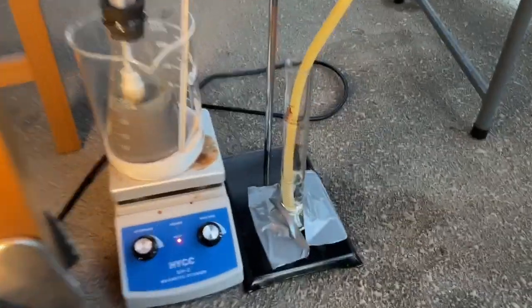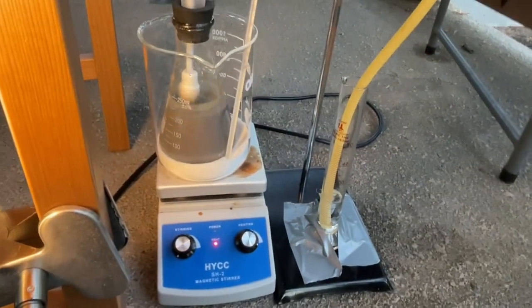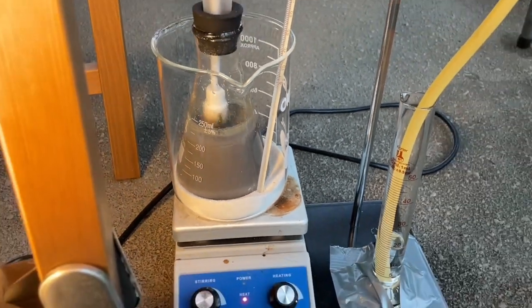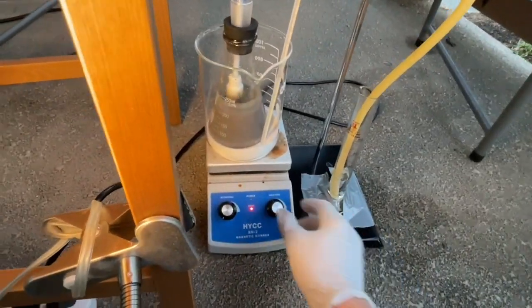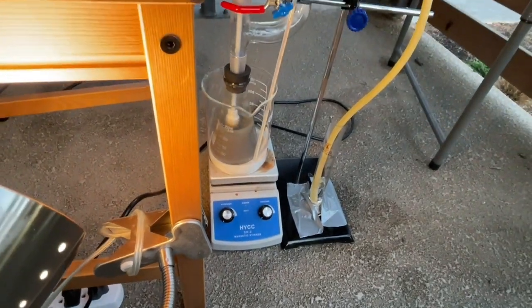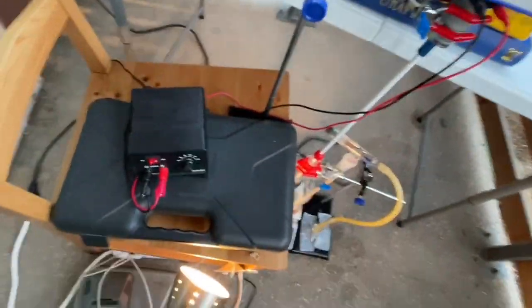In the morning, after about 10 hours of reacting, the bubble trap had backflowed, indicating the reaction was complete. Upon inspecting the reaction mixture, it looked like there wasn't very much sodium and it was collected into a fine silt. Upon pouring this through a strainer, there weren't any noticeably large blobs of sodium I could find.